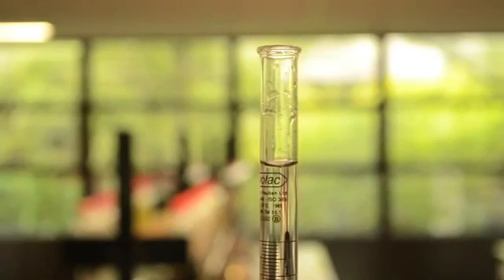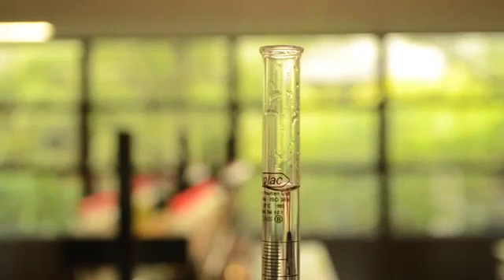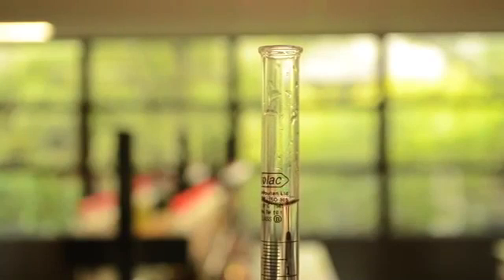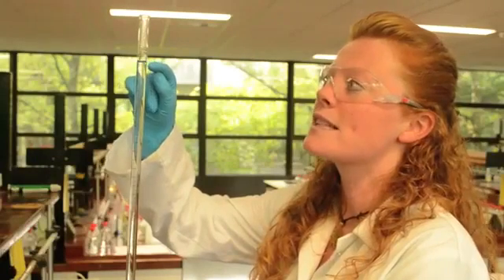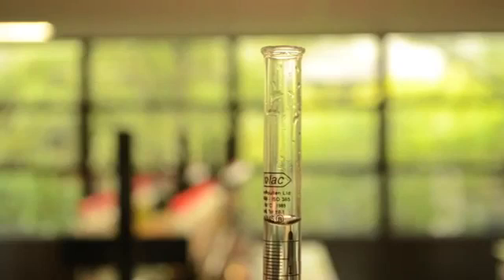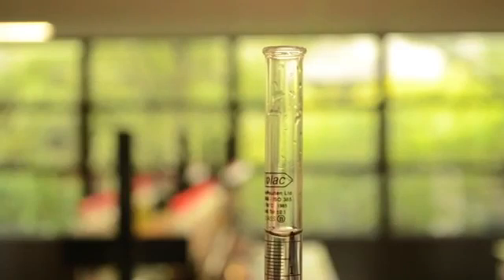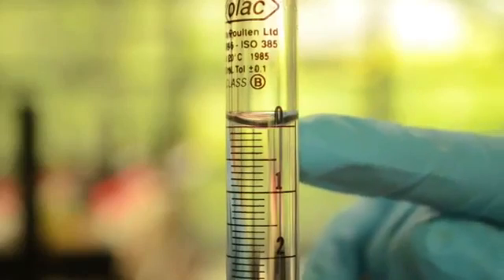Once I fill the burette, I release this volume down to close to the zero point mark by opening up the tap. I want the bottom of the meniscus to sit on the zero point graduation mark. And there we go.